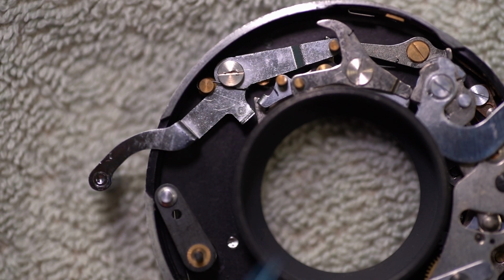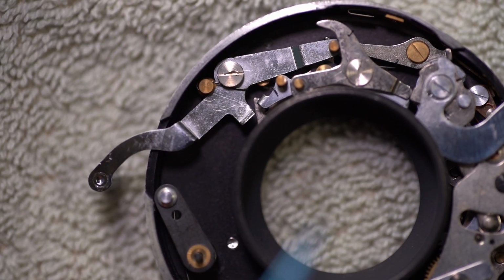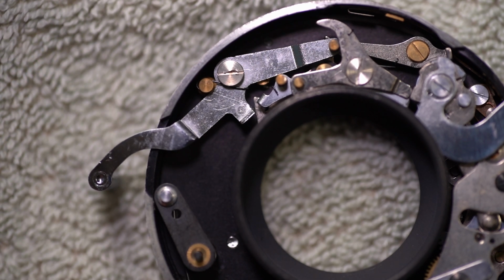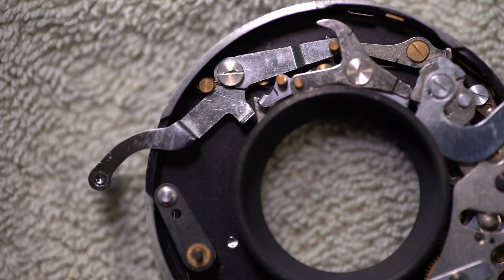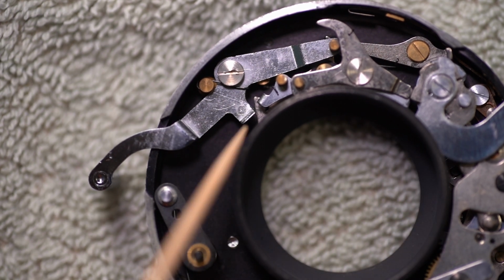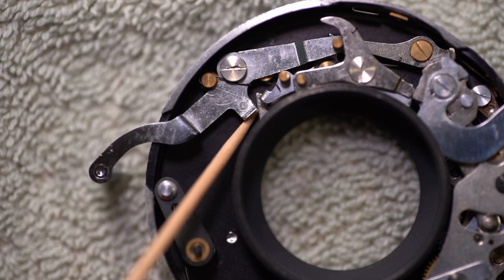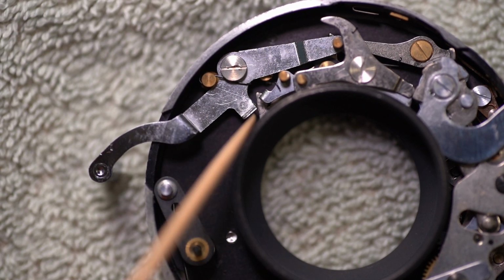I don't know exactly what it is. I don't even know what part of it does it. The rest of this mechanism that is 50 or 60 years old is flawless. It's wonderful. I'm not going to mess with this at all, except to take a toothpick with some sort of grease or oil and very carefully put it on the bottom side of that, or on that pin and on the contacting part of that lever there.